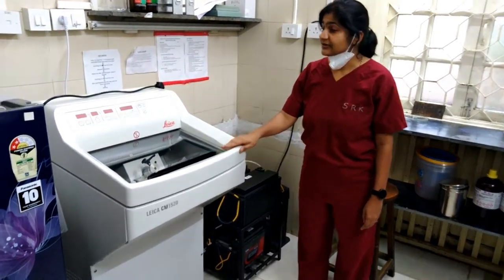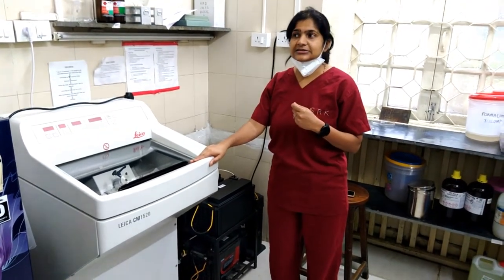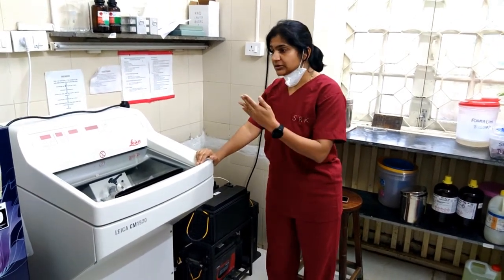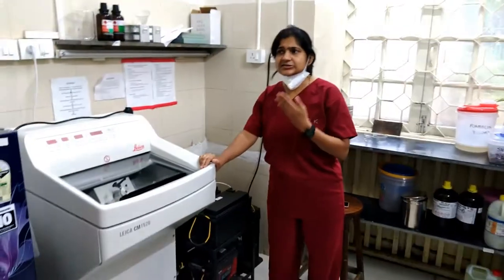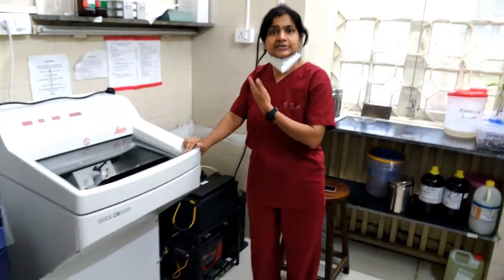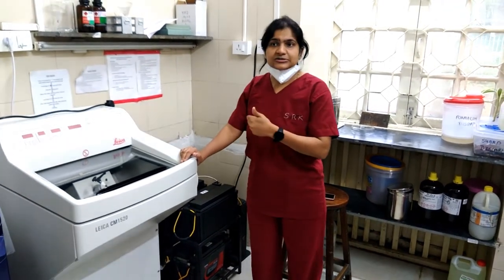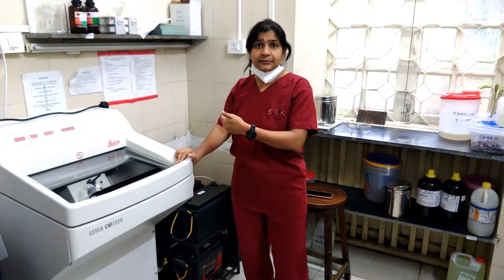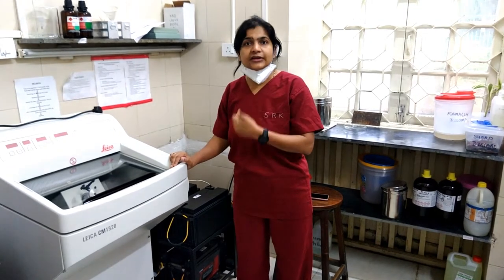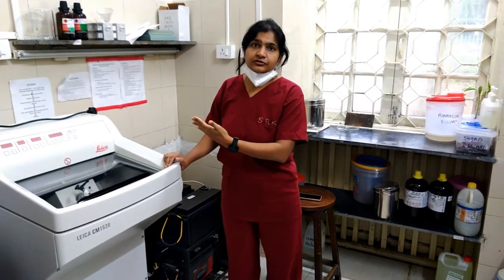This is the cryostat. The cryostat is used to perform pathological analysis of tissue samples from various soft tissues — maybe muscle, brain, skin, and so on. The most important use we have established at Wadia is the muscle biopsy, which is done to diagnose various genetic neuromuscular disorders involving dystrophies as well as mitochondrial disorders.